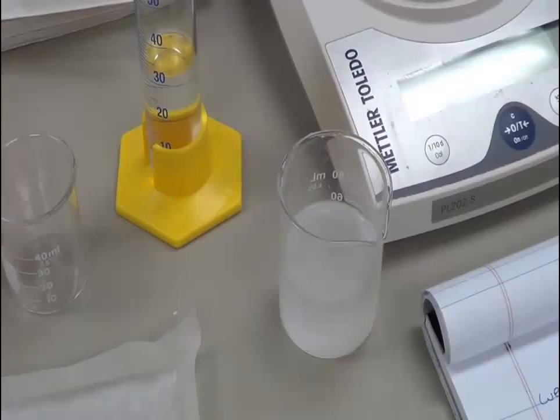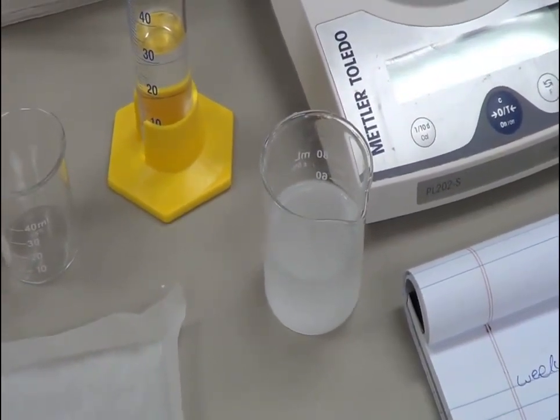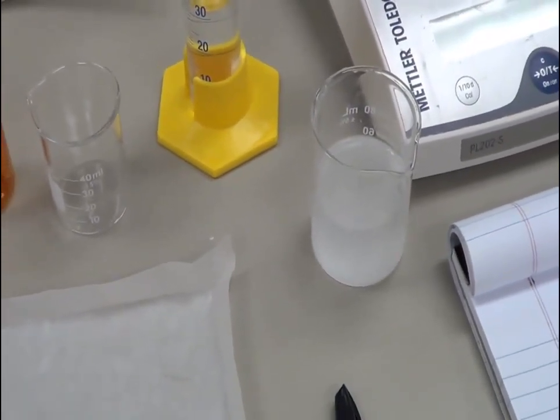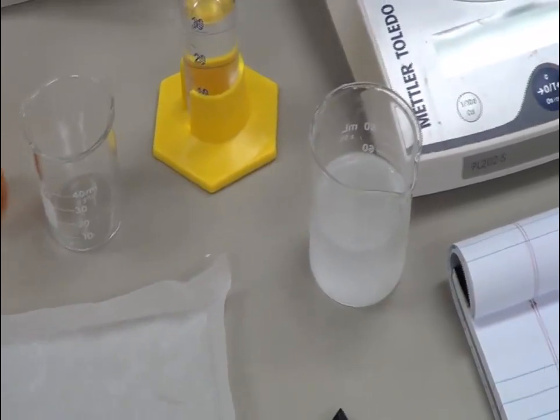I have prepared a 1% solution, which means one gram in 100 ml. I took 100 ml of water, boiled it up to 60 degrees centigrade, and slowly placed one gram of methyl cellulose into it using a stir bar. This is the 1% methyl cellulose solution.